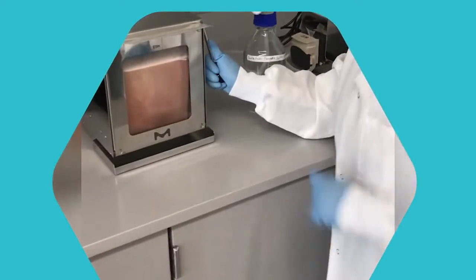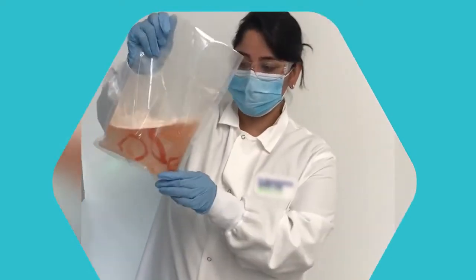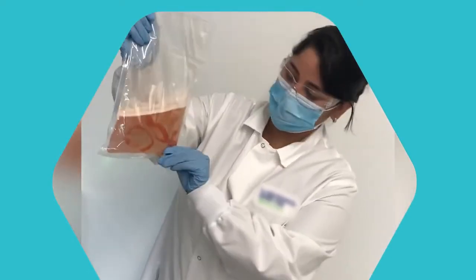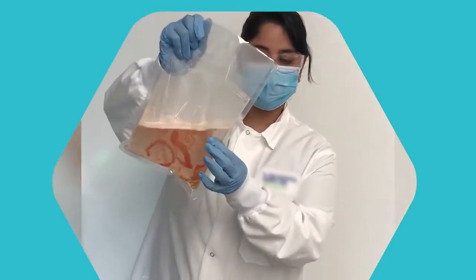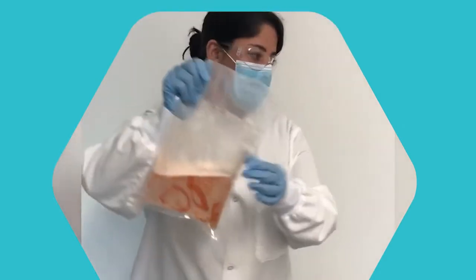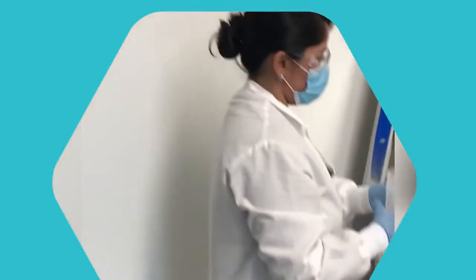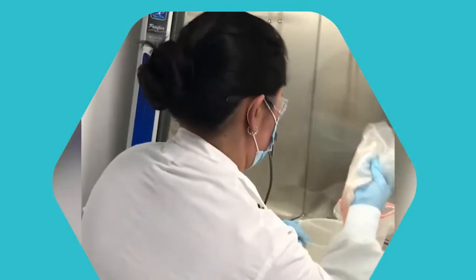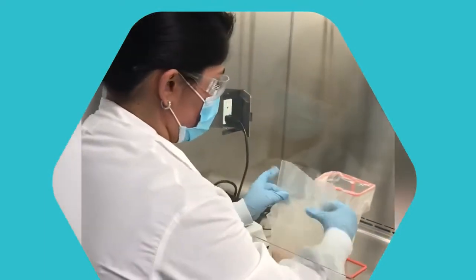All right, so the blending is now done. As you can see, the tomato has blended really well and we have our liquid extract that we're going to take. We're going to come over to the hood area here and put the sample in a secure area.